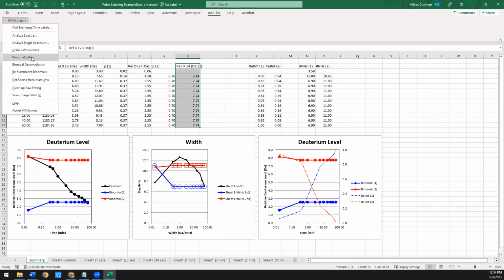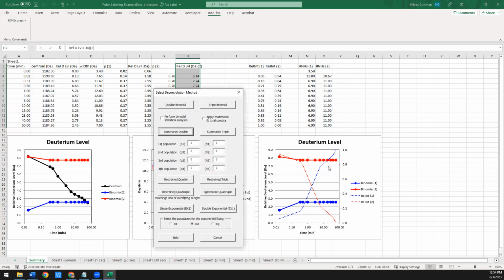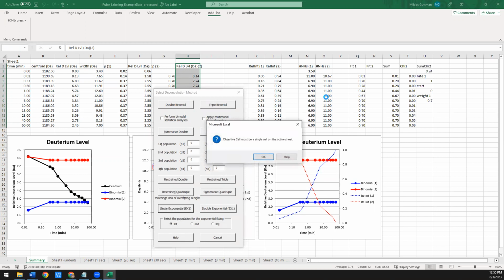The last thing I'm going to point out, which is a function that you might not need because most people will just use HXExpress to do these fits and then move the results to whatever program they want to do any other fits with. But if you want to just do a quick exponential fit to how these populations change over time, there is a function for that down here. So if you want to fit a single exponential to, say, this blue dashed line, you would say, select the population for exponential fitting. I'm going to do binomial 1, so the first population. I'm going to say, try to fit that to a single exponential, and let's see what we get.